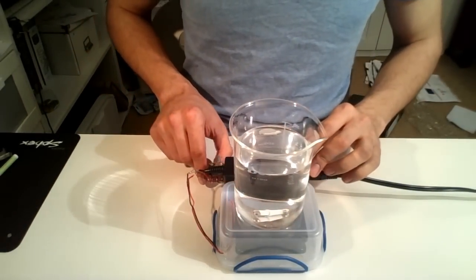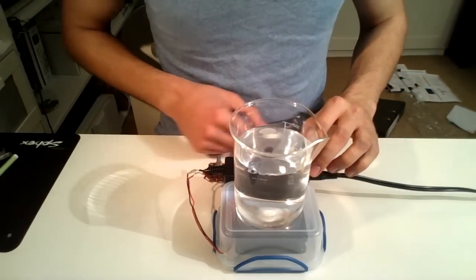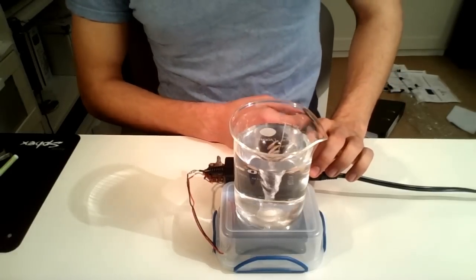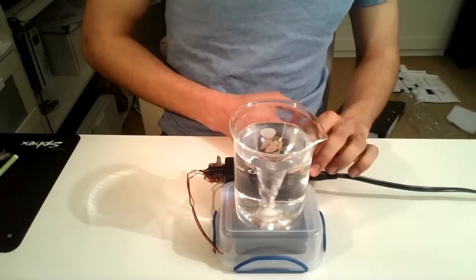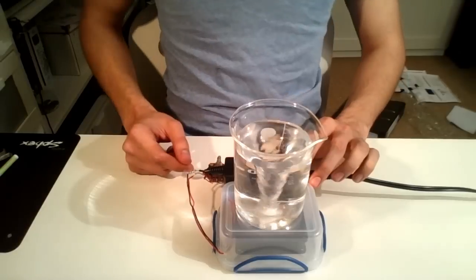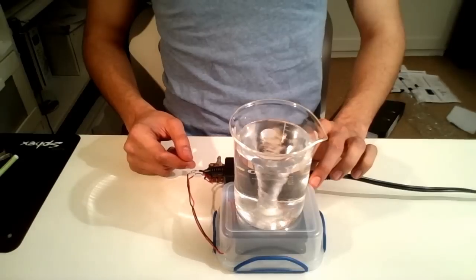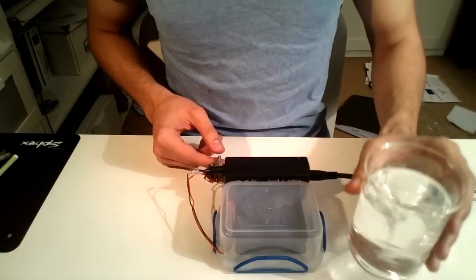Alright, so just turn it on. And it's got two speeds. There's speed one. As you can see, it's actually already to the bottom. Here we go to speed 2. There you go.